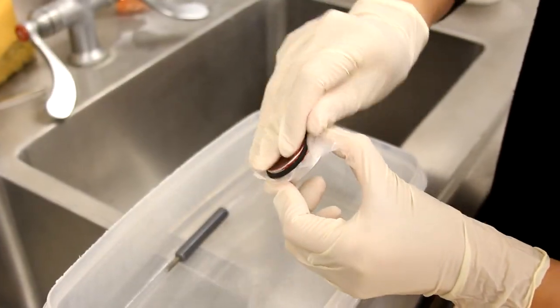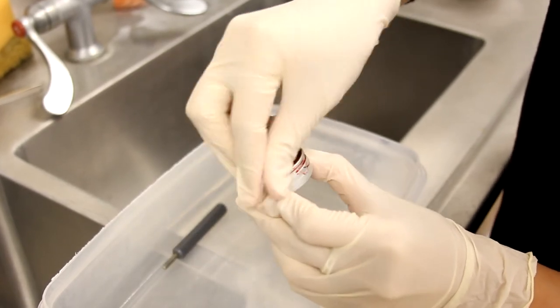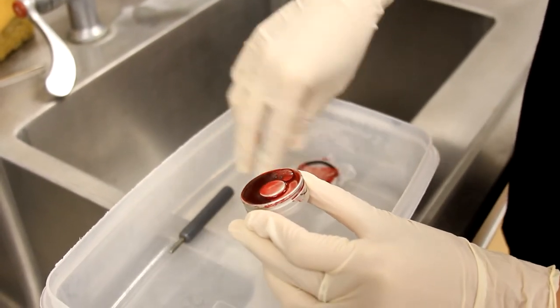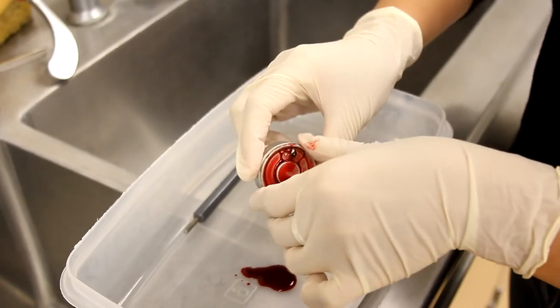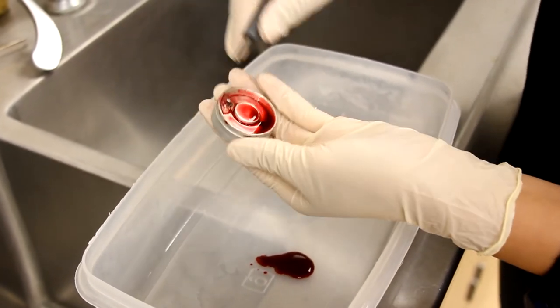To clean the reservoirs, unscrew them from the power unit and remove the parafilm, o-ring, and plugs. To remove the plugs, use the plug extract tool to push them out from the top of the reservoir.